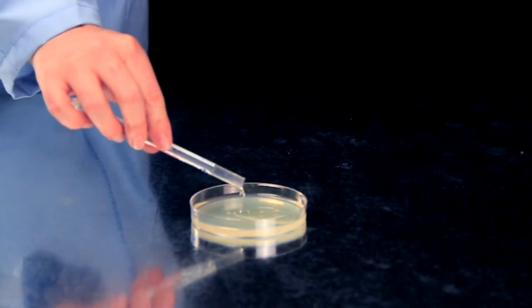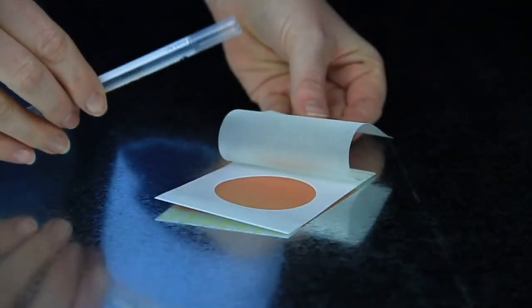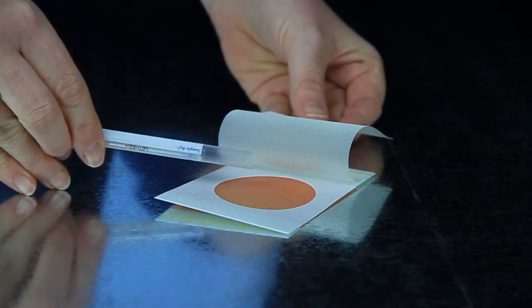The final step is transferring the sample. Q-Swab rehydrates one agar plate or one dehydrated media film perfectly.